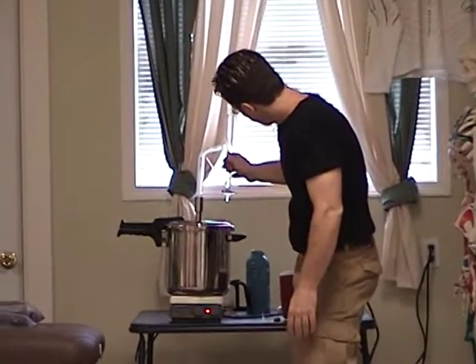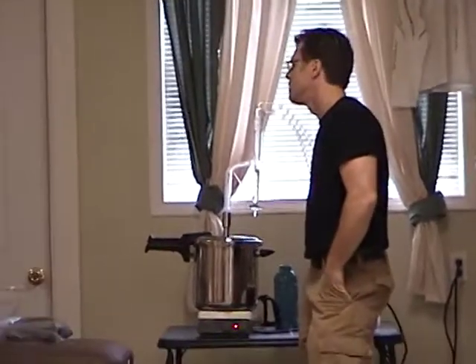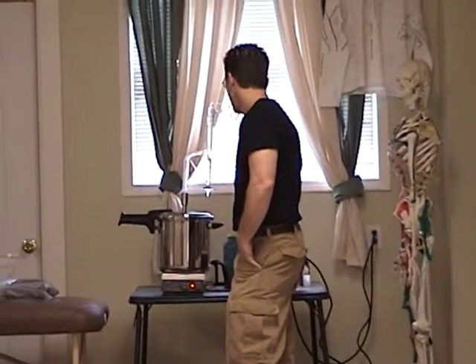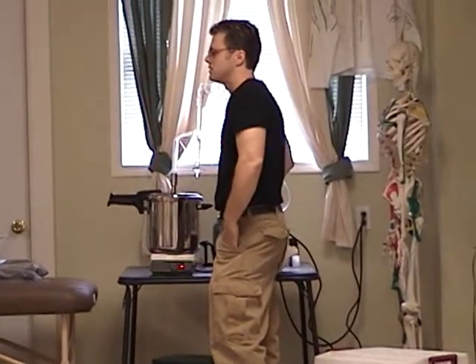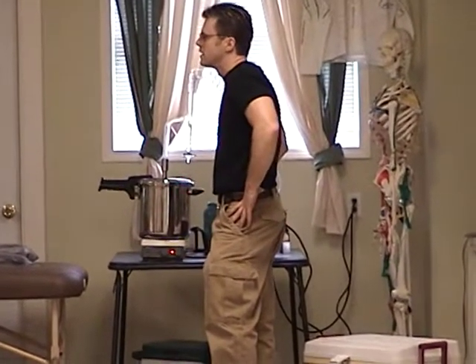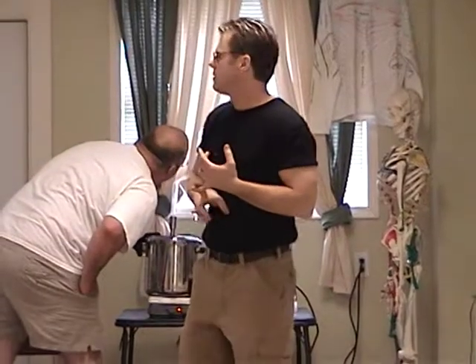The oil is coming over a little fast — you want it coming over about one drop per second. We put in probably about 600 grams of flowers, so we should get about six milliliters or six grams of oil — a 1% yield. It's not a lot; it takes a lot of material to make these oils. That's why the real oil is not going to be cheap. Lavender is one of the more inexpensive ones because it's mass produced, but it is still a very adulterated oil. The two main chemicals in lavender are linalool and linalyl acetate.